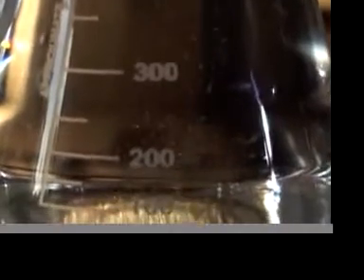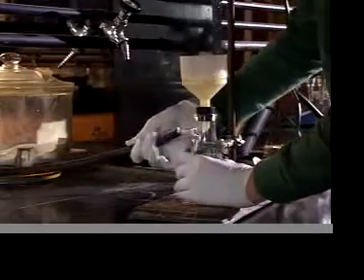Now we force the liquid to solidify, also called precipitation. Excess water is then suctioned away.